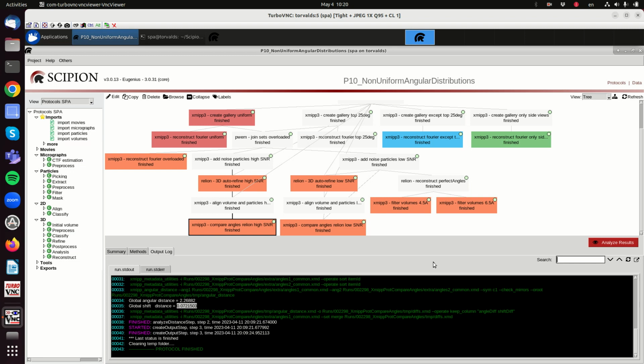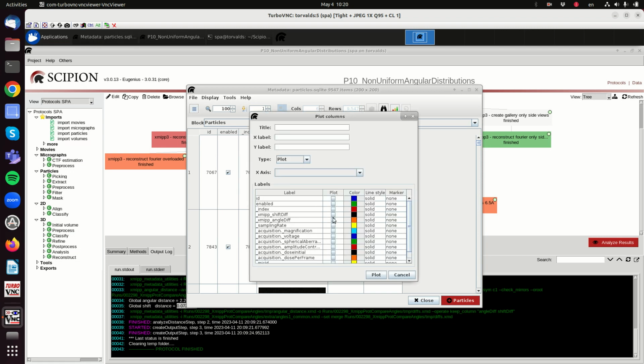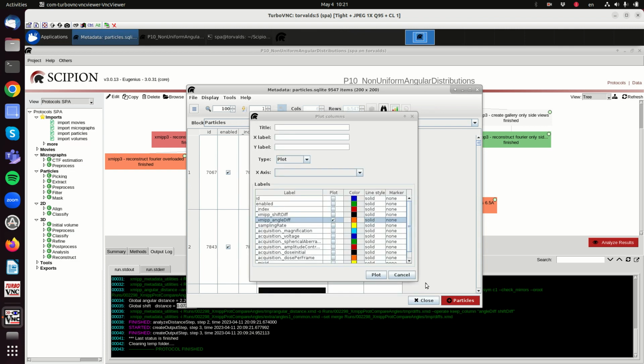So we can check, for instance, the angles, and the angles here, for most of them we did a very good job with a very low angular error, and then for a few of them, for a fraction of them, that is about 10%, 15%, we have made much bigger mistakes. And despite the fact that these images are very clean, really clean.